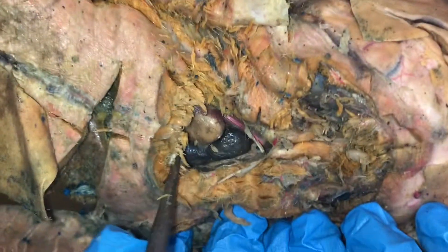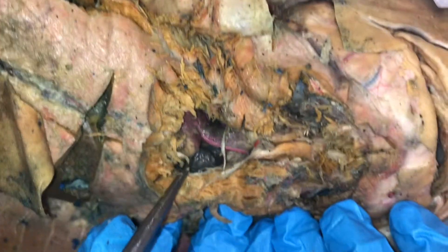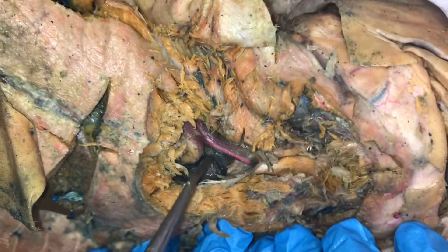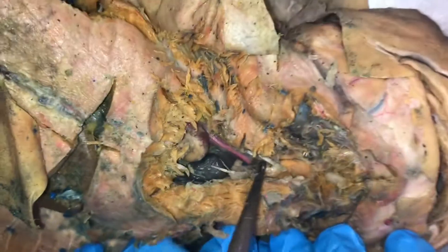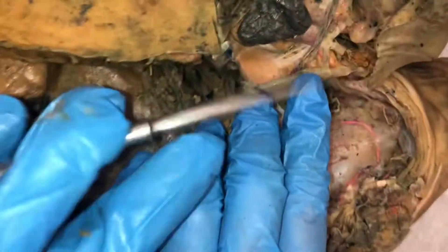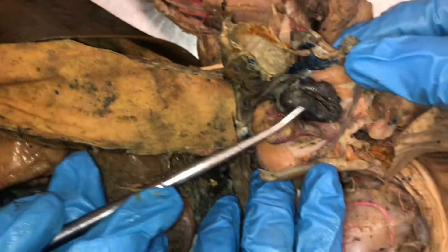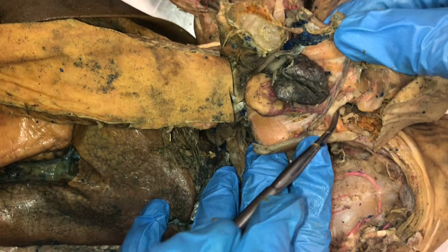We have the heart. The transverse septum would be down in here. This is a ventricle and this is an atria. The conus arteriosus is up here and the coronary artery runs along the side, and the ventral aorta is going to be way up in there. You can see it around — so you have your atria and your ventricles under it, coronary arteries, conus arteriosus, ventral aorta.